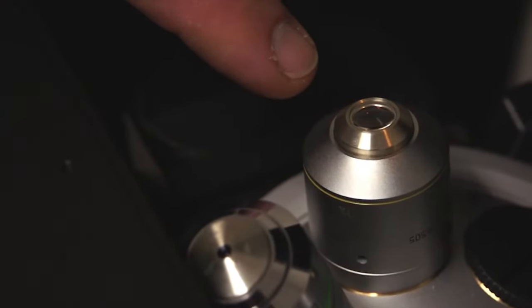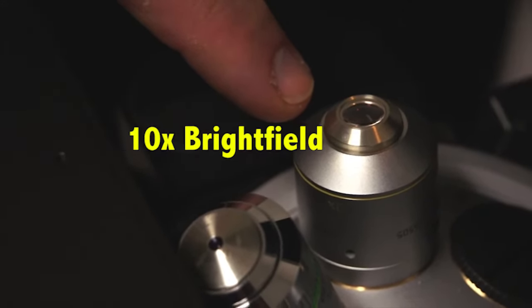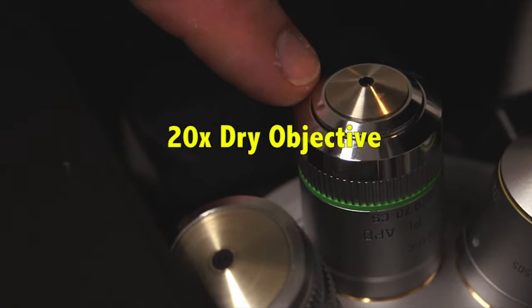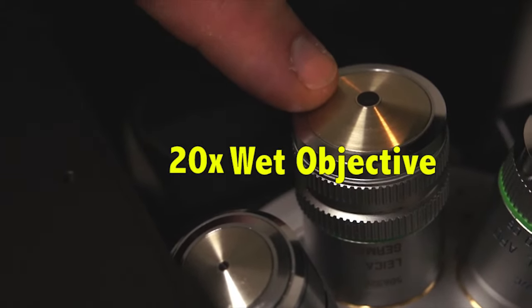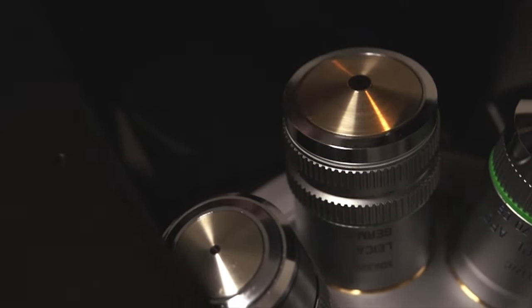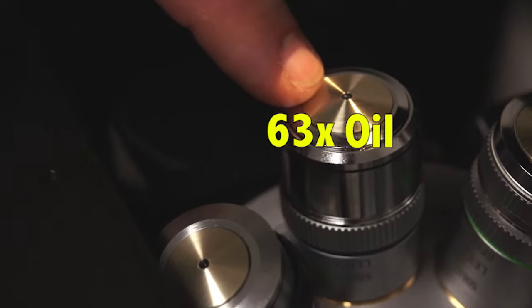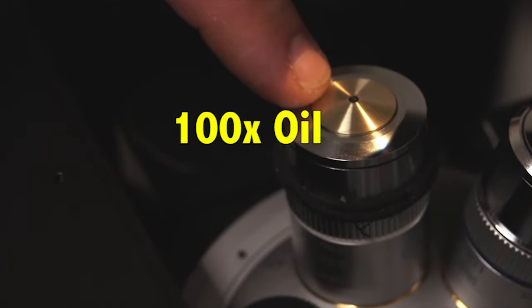The Leica confocal microscope has a series of 5 objectives. The lowest power is a 10x bright field objective, and it's a dry objective. The second objective is a 20x dry objective. The third objective is a 20x, but this is a wet objective. Therefore, it's an immersion objective. And so you would put a drop of oil on the front element of the lens before you put your slide down onto the objective. The fourth objective is another oil immersion objective. This is a 63x oil. And finally, the fifth objective is a 100x oil objective, also immersion.